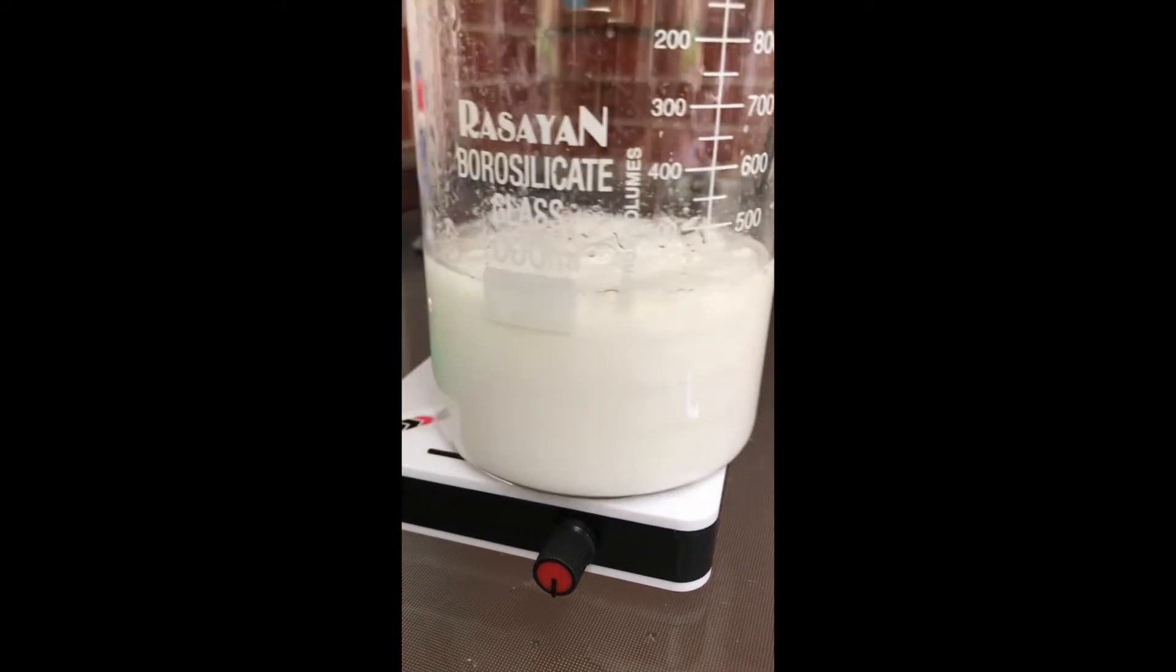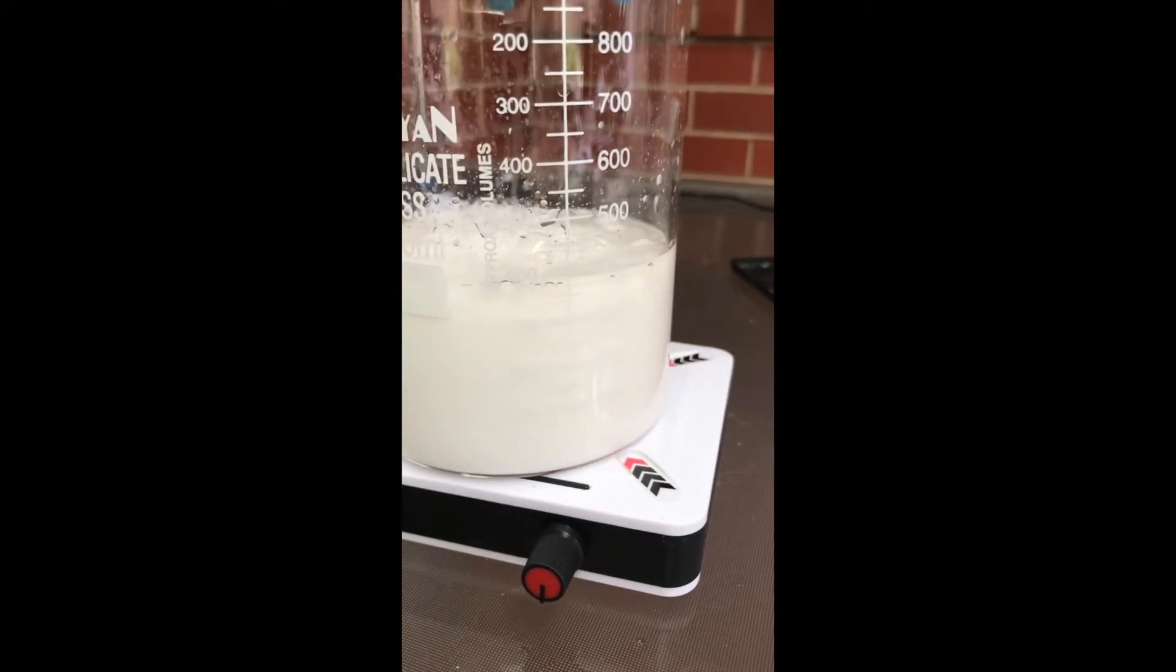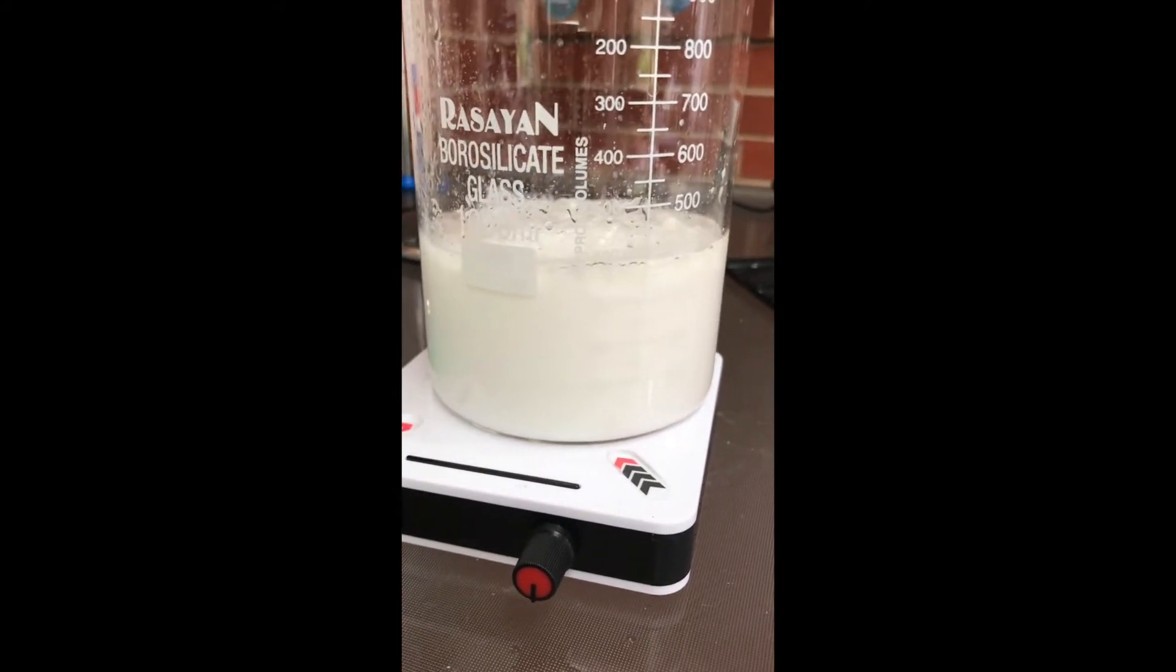To ensure that this reaction is fully complete, stir thoroughly. Off camera I used a glass rod to stir more vigorously.